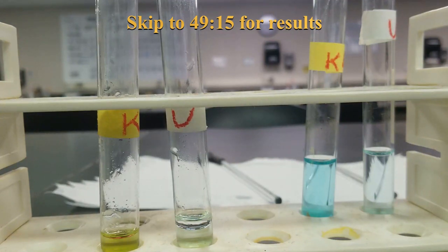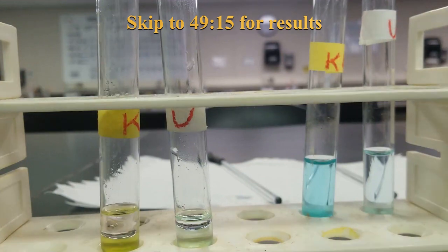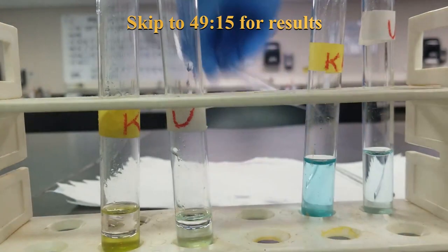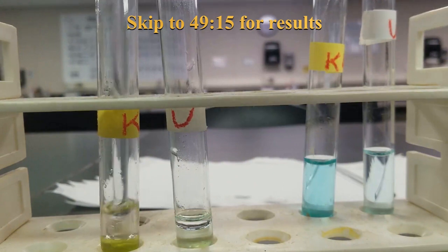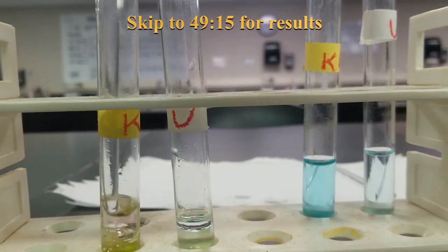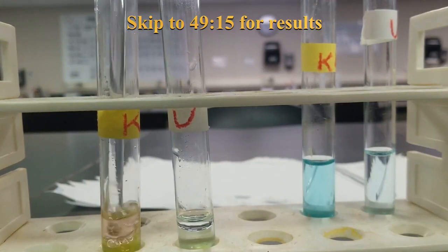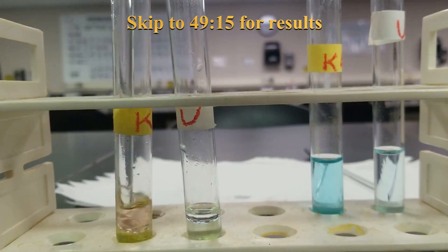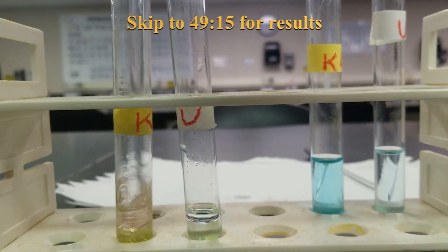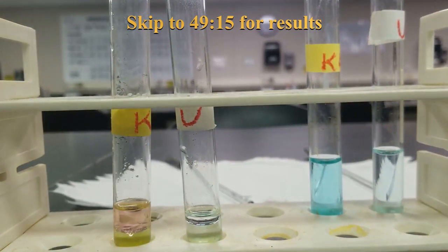Add some more toluene. A bunch more just to get it all out. Toluene's a non-polar solvent, so it doesn't mix with water. See, we're getting closer. Keep going.